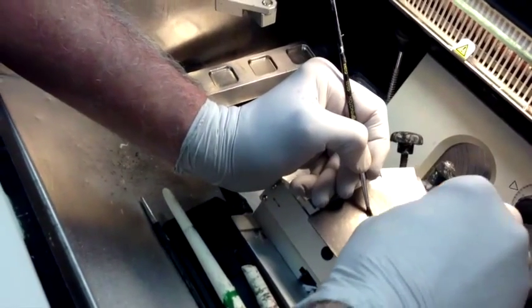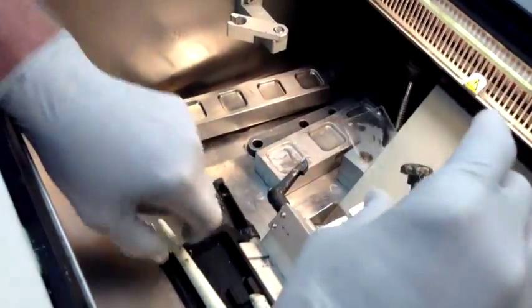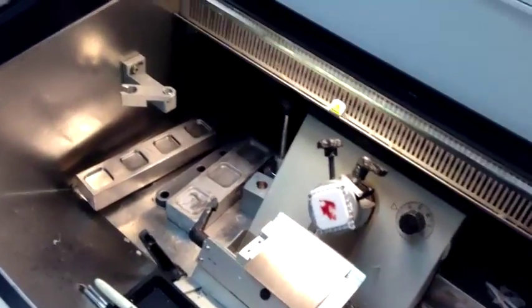Making sure I hold this down with the brush, and I have to come at it pretty quickly because there's a lot of static electricity. There we go — that came out well. And there we have essentially an exhaust block. We're going to go into the cassette. Here we go.